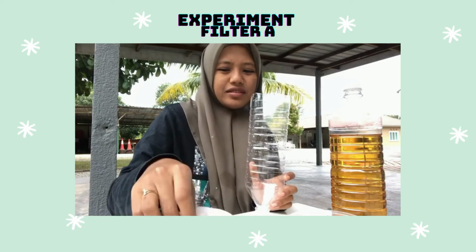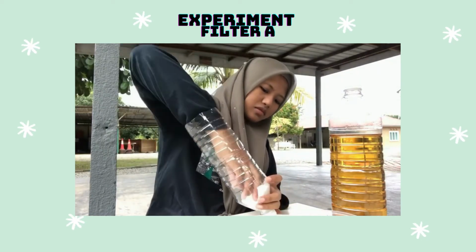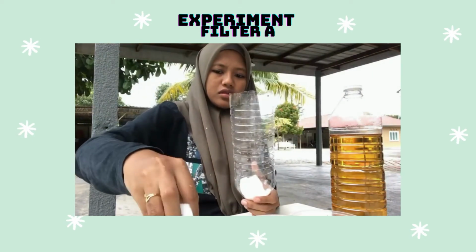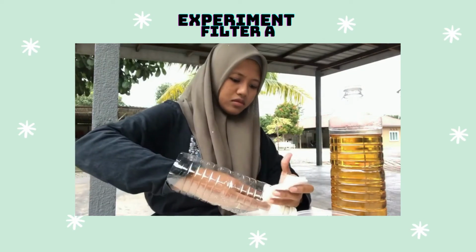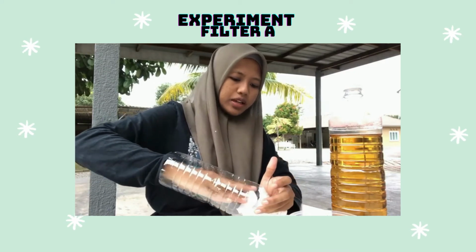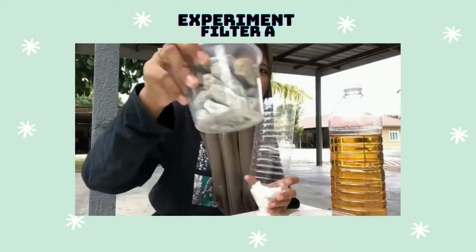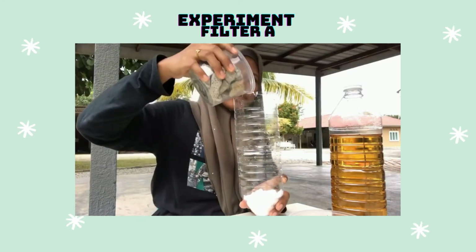After putting the cotton pad, we put coarse aggregate around 8 cm.